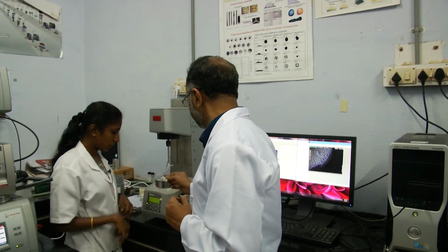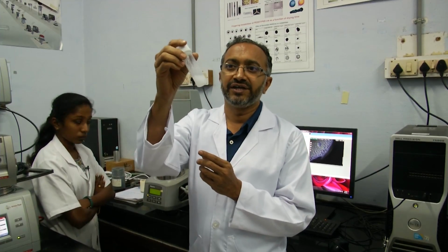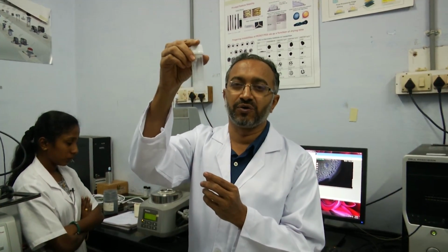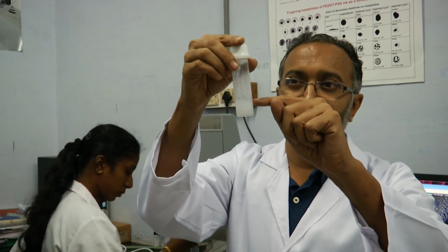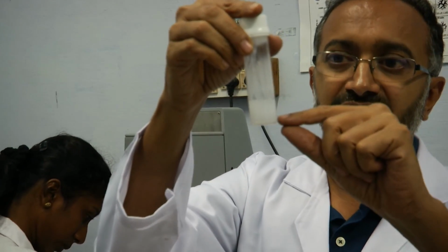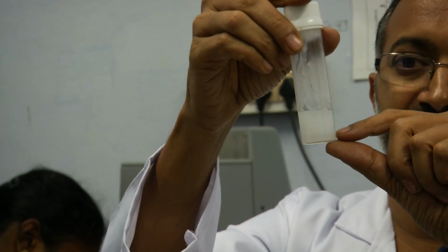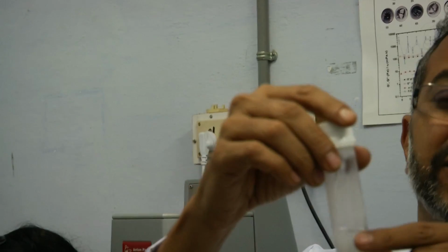So in this case also, what you can see is this sample is fairly homogeneous throughout. Given that it's an emulsion, it is entirely possible that at the top there may be a small cream layer, or given that it's oil in water, there may be a small clear water layer below. So in this sample you don't see such heterogeneities, but if such heterogeneities are there, you need to worry about what are the measurements, what part of the sample you are measuring, and what do your measurements mean.